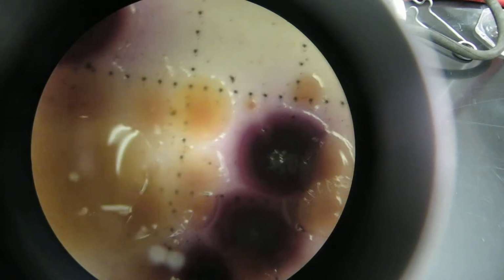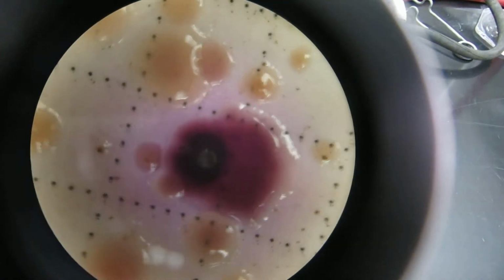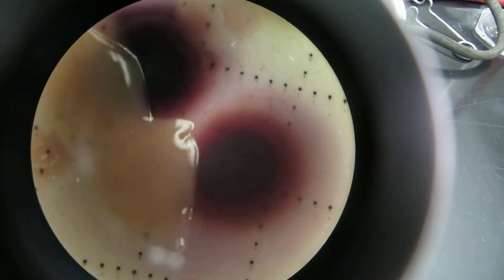Anyway, I wanted to show you this for mTEC. It's these purple ones. See these yellow ones here? These are interference bacteria. That's just background bacteria that happen to grow on the plate. It usually grows when you leave it in the incubator too long. I counted them and then left them in there, and then I made this video so you can see that.